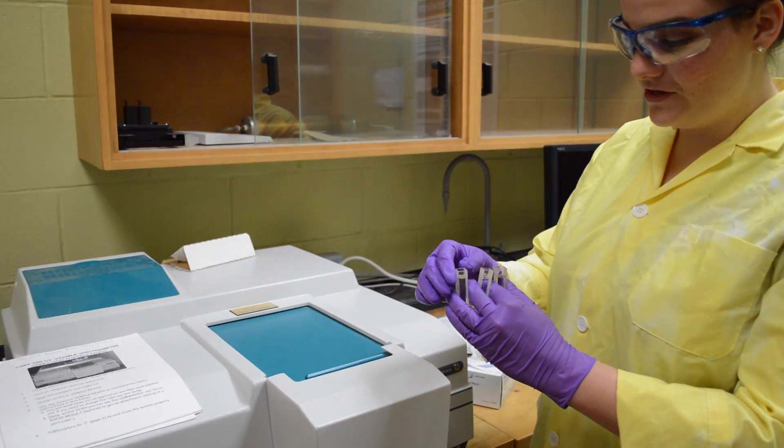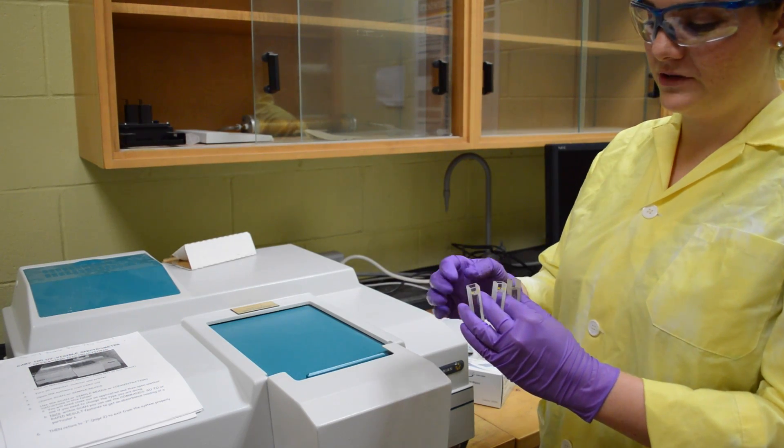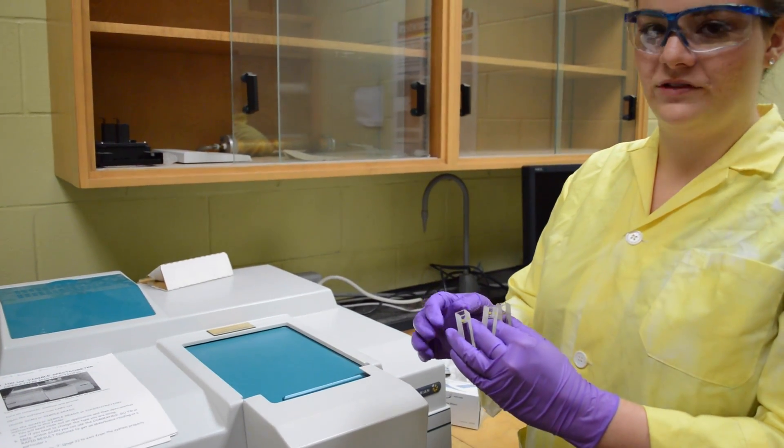When the machine is turned off, you are going to put the samples in the correct waste bin and properly clean the cuvette for the next use.